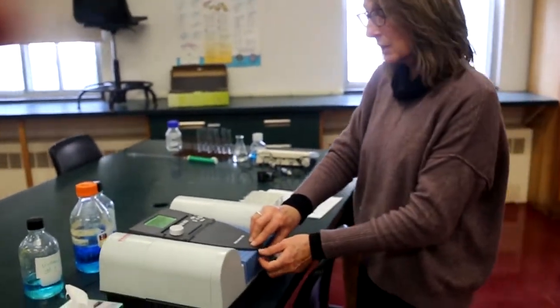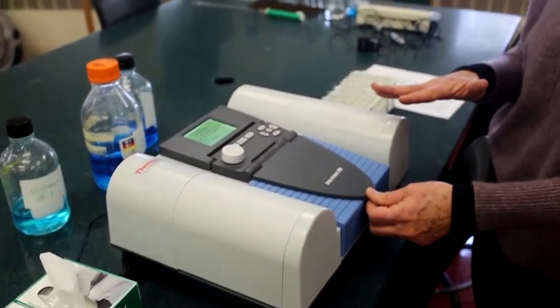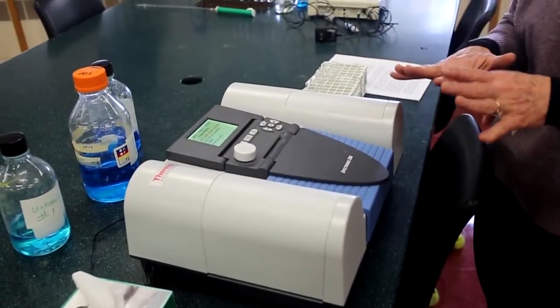So it's really simple. One thing to remember, though, is before you ever take a measurement with a spectrophotometer, you always need to zero it or calibrate it. It's called zeroing or blanking. It's like when you use a balance and you put the weigh boat on and hit blank or tare, it tells the instrument what zero is. So before you start, and every time you change the wavelength on the spectrophotometer, you always want to put a tube of plain water, or whatever makes sense for the experiment or the measurement you're taking, in there, and then you can hit a button called blank, and that will tell the instrument that that's considered no absorbance. So it's important to have that concept.